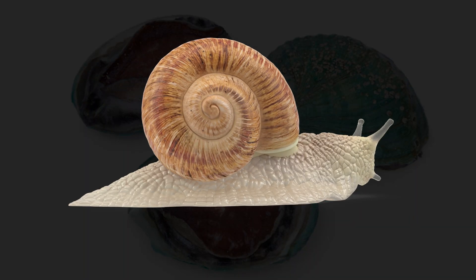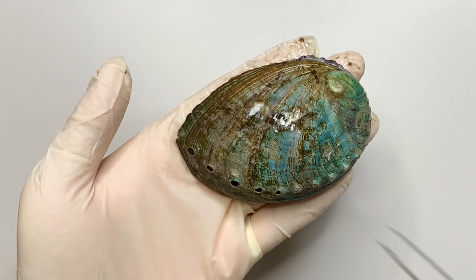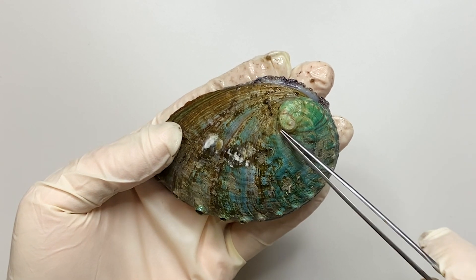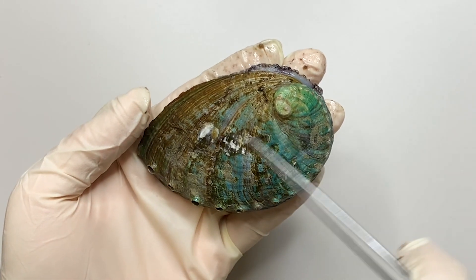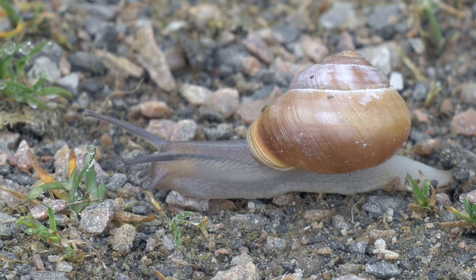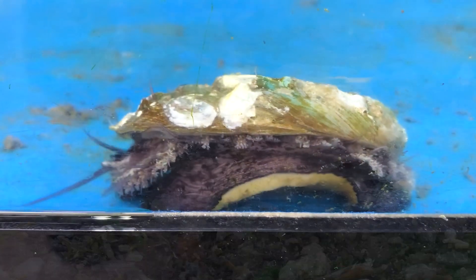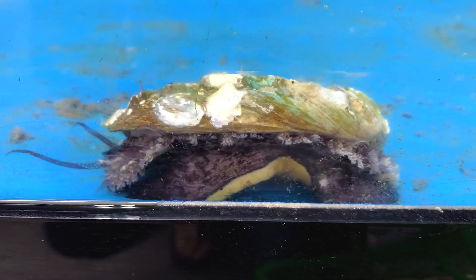Most gastropods are characterized by spirally coiled shells. If you look closely, you can see the shell of the abalone is also spirally wound. In addition, there are many snail-like features on the body of abalone.